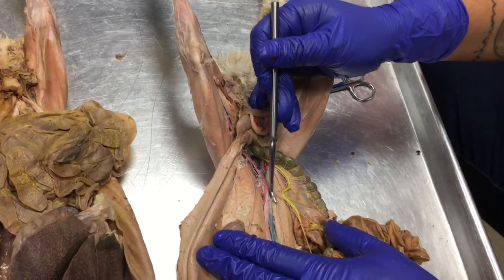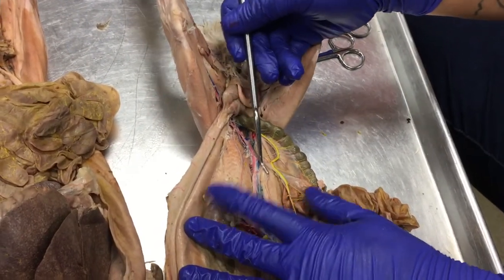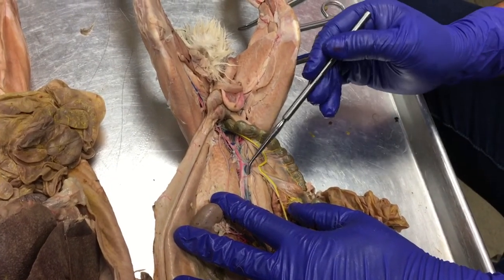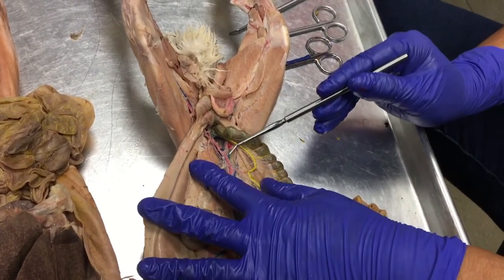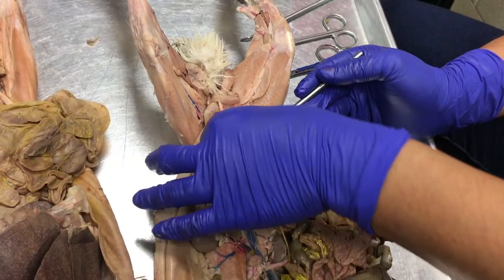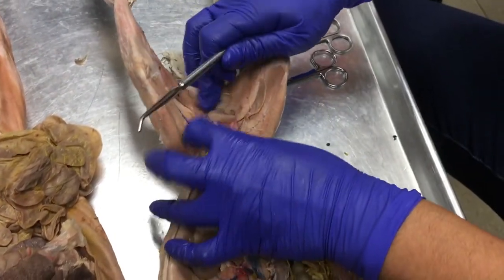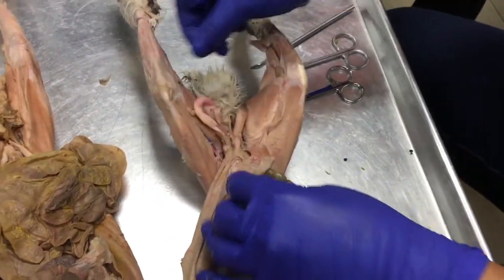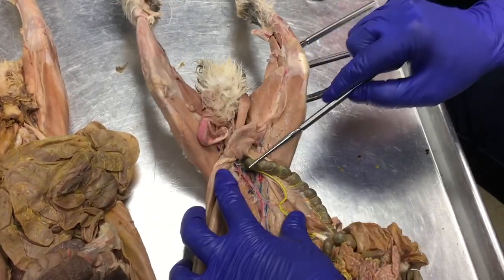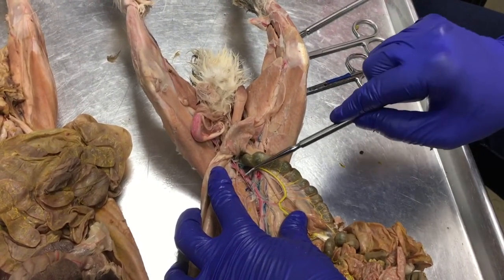The right testicular artery here is branching off anterior to this posterior mesenteric artery, so it's way up here. And this testicular artery that we dug out last time, a yank on it, we'll be able to see, there it is, poor little testis. It continues out to here, but see this artery and vein pair right here?